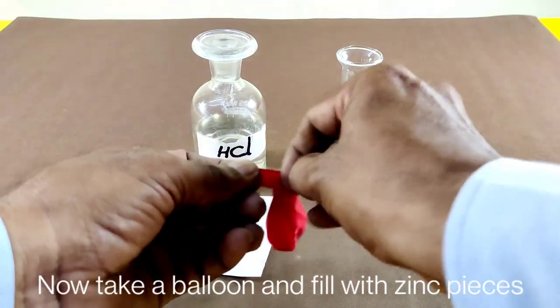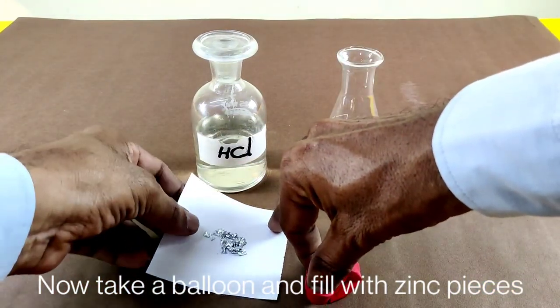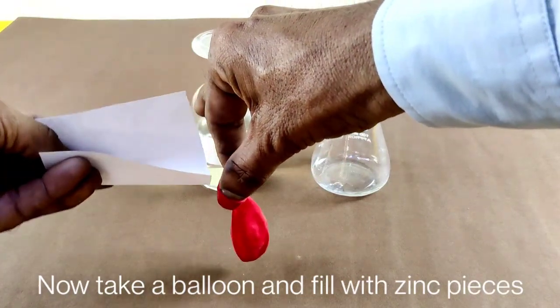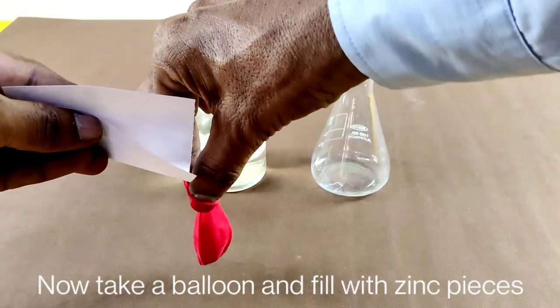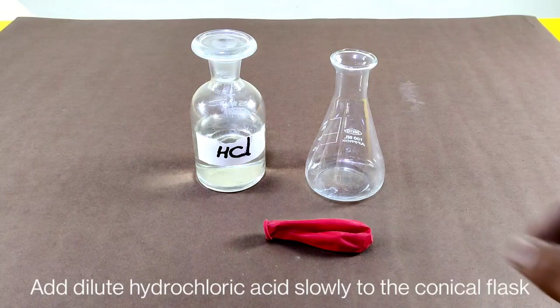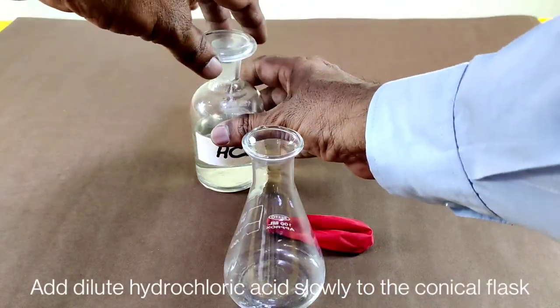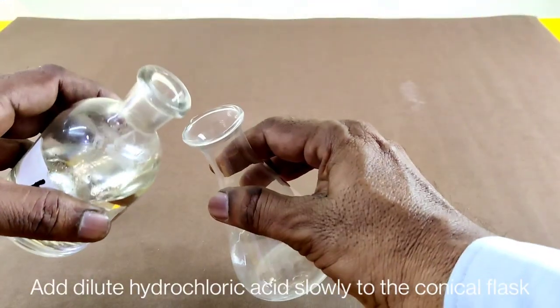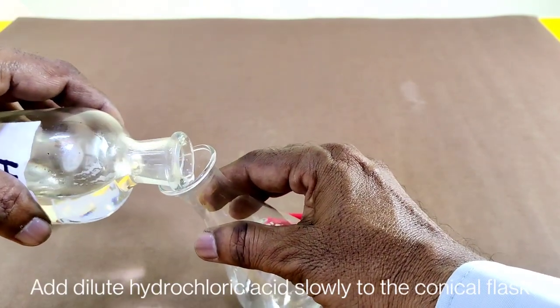Now take a balloon and fill it with zinc pieces. Then add dilute hydrochloric acid slowly and carefully to the conical flask.